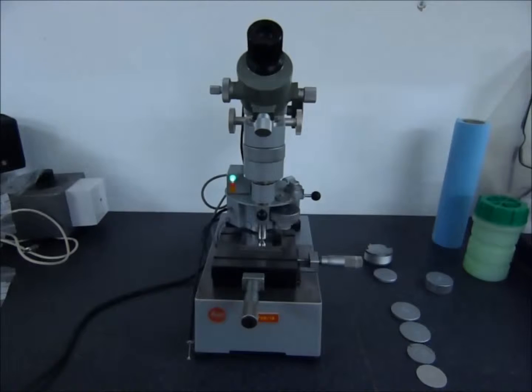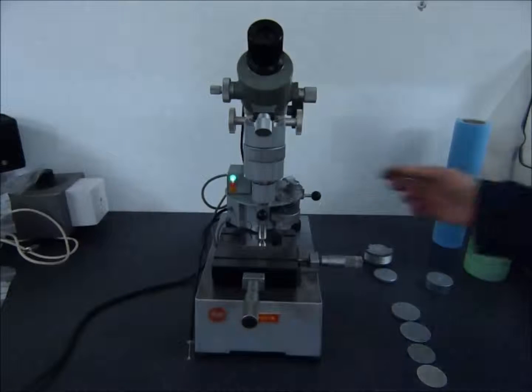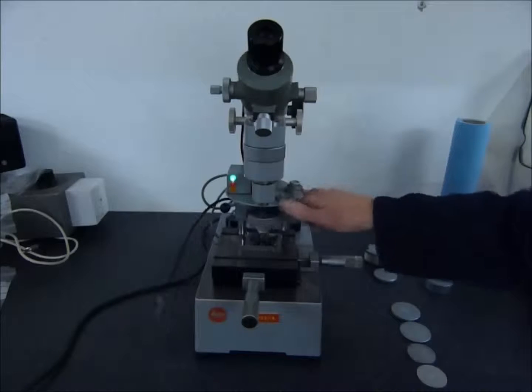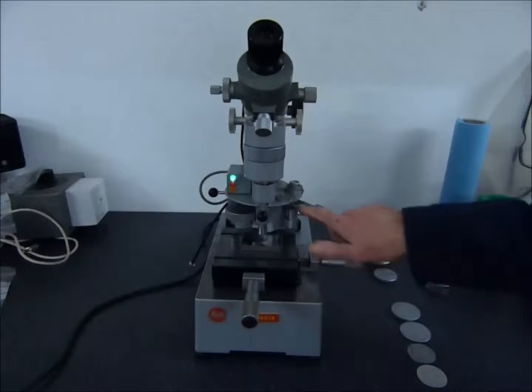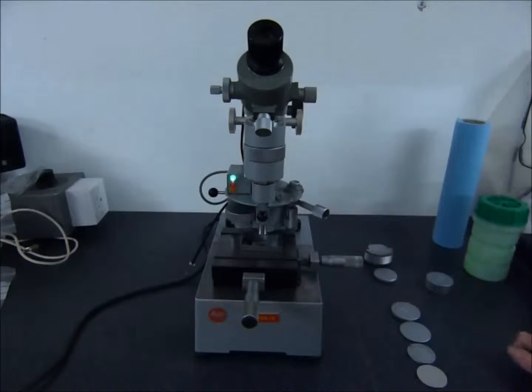Basic setup of the machine. Ensure that the oil damper is filled with the watch oil.